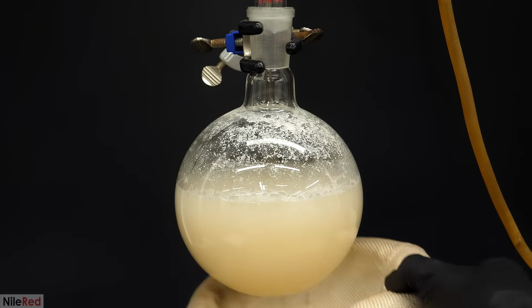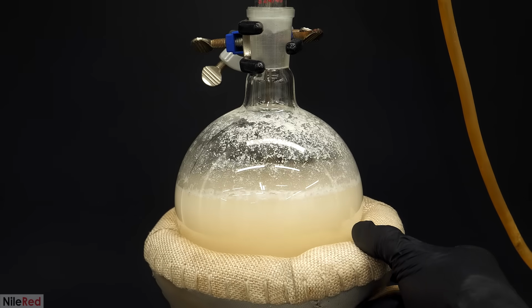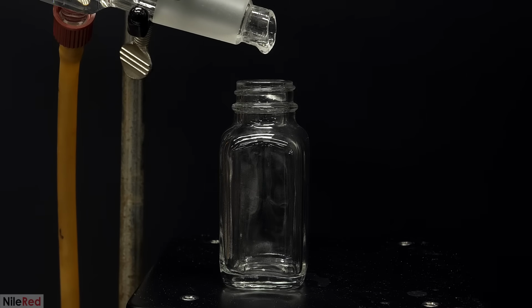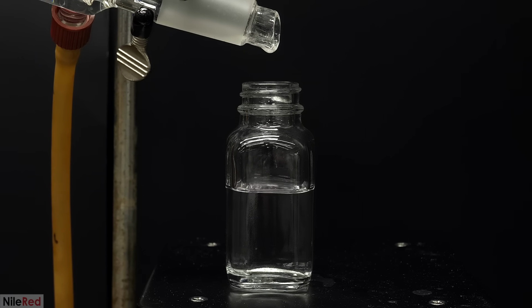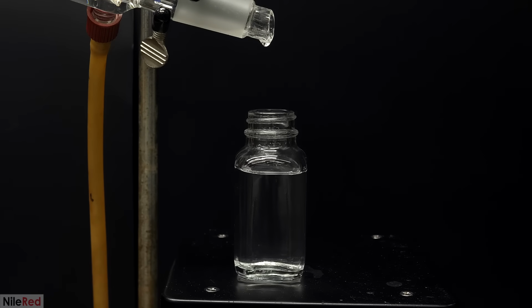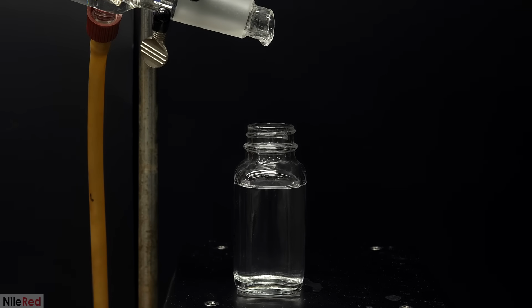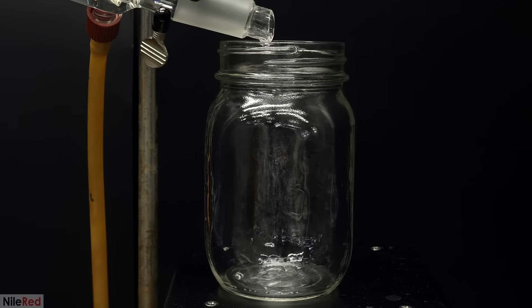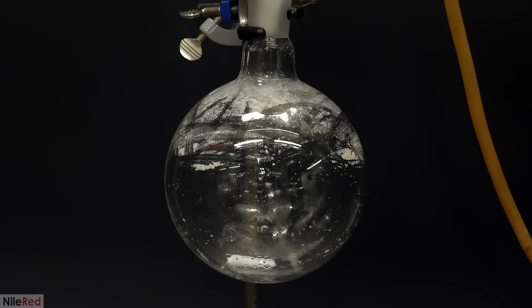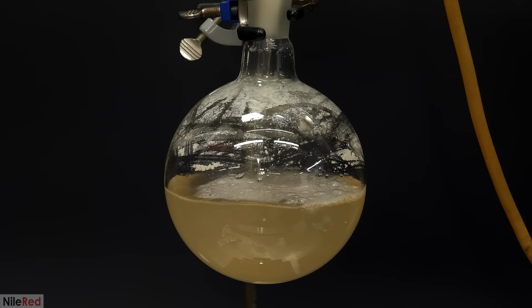This time, because it was going to be a lot slower, I expected the ethanol coming over to be more concentrated, and I started with just a small vial. However, after a bit, I realized that I was going to be collecting a lot more than this, and I swapped it out for a mason jar. Then, just like the other run, I did it until a taste test told me that there wasn't any more alcohol coming over.